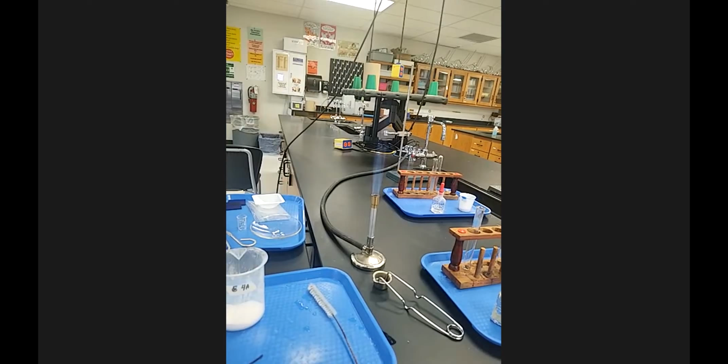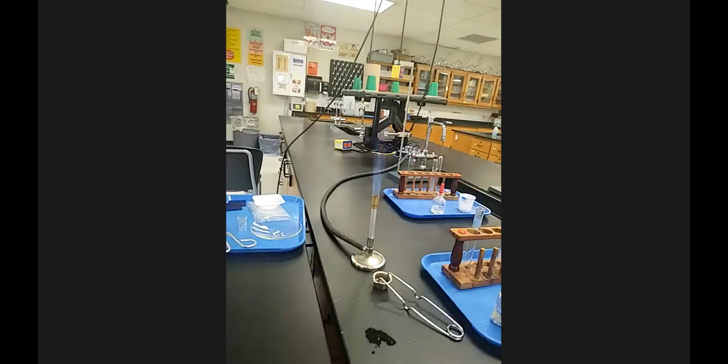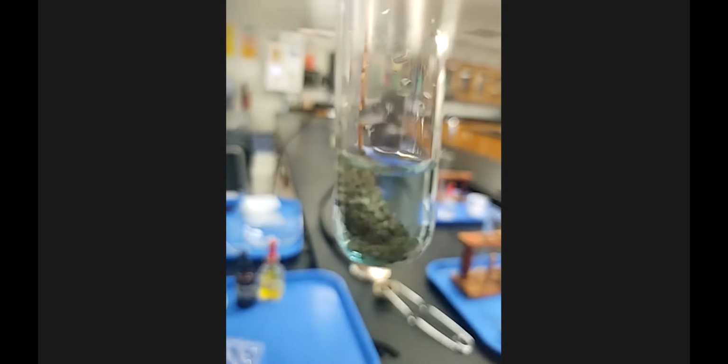That is station 4. Let's take a look at our station 1, and then we'll go back and do station 5. See what station 1 is looking like. Okay, so here is, it's not so pretty anymore. So I wanted you guys to see it when it was. All right, so here is station 1, and this is longer than you guys would have viewed it. Okay, trying to get it in focus here.